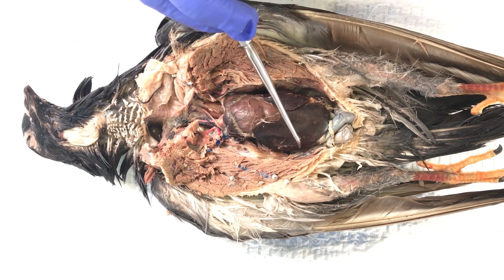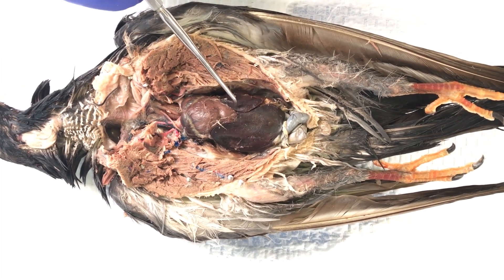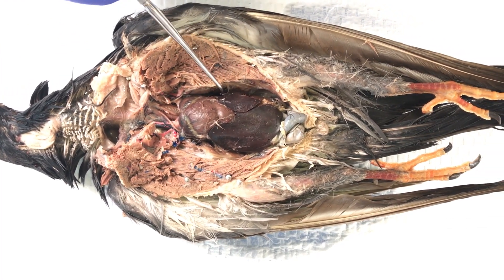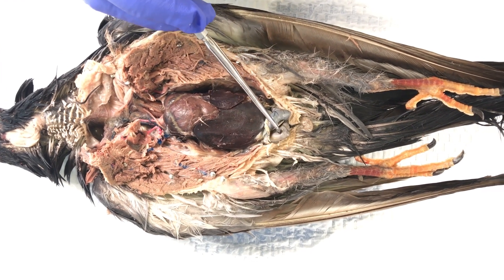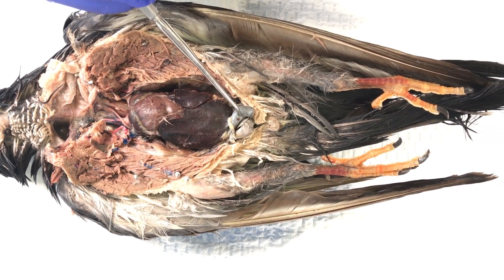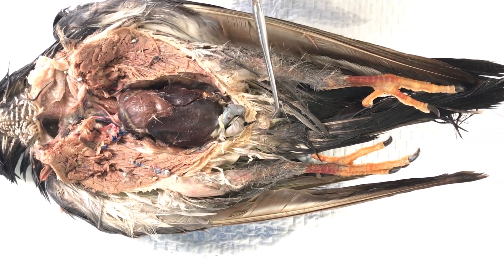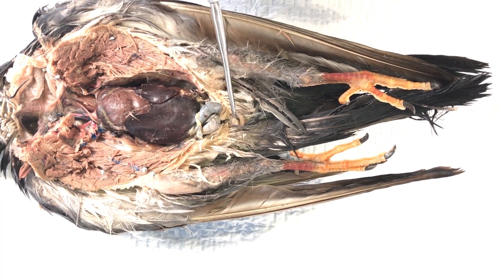There are the lobes of the liver. Below that you can see the small intestines, the contents of which empty through the colon and out through the cloaca.